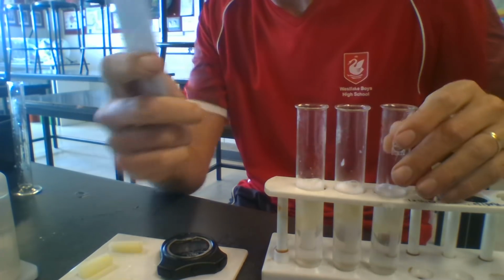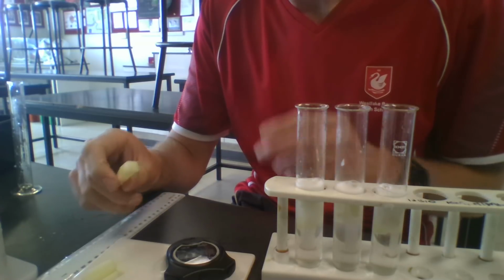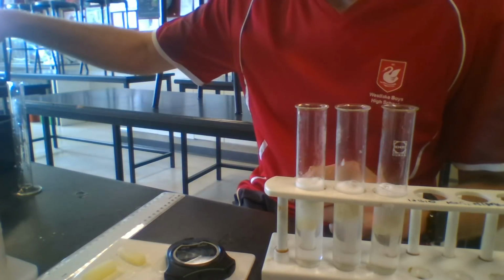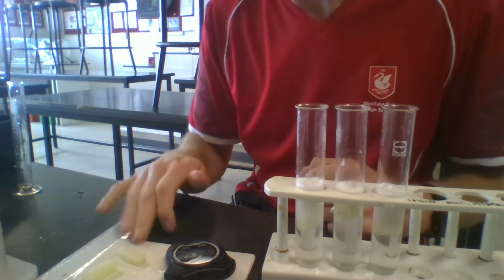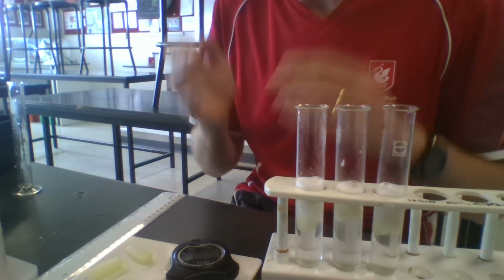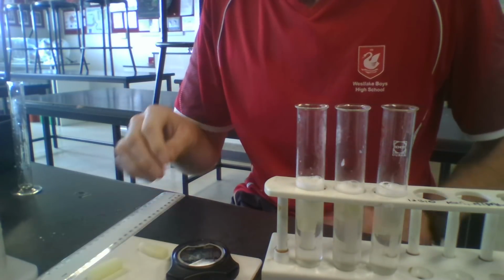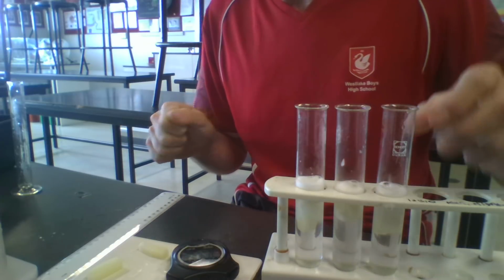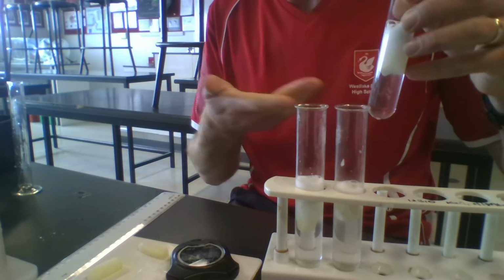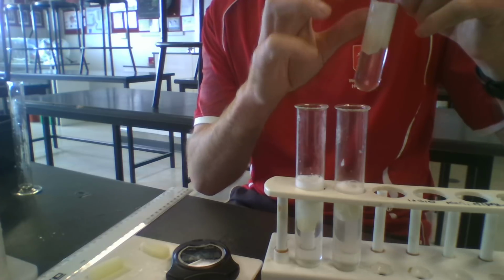Well, the reason I'm measuring the foam is because the reaction that's taking place is between an enzyme, a chemical that's inside of the potato cells, and the oxygen, which is in hydrogen peroxide. Hydrogen peroxide is similar to water, but instead of being H2O, it's H2O2. It's got an extra oxygen atom attached to it. So the enzyme catalase, which is in the potato, chops off that extra oxygen from hydrogen peroxide and releases it into the solution, into the boiling tube, and that oxygen reacts with the detergent and creates bubbles.